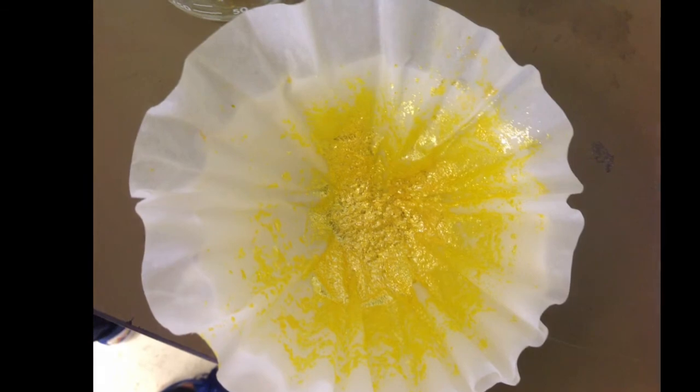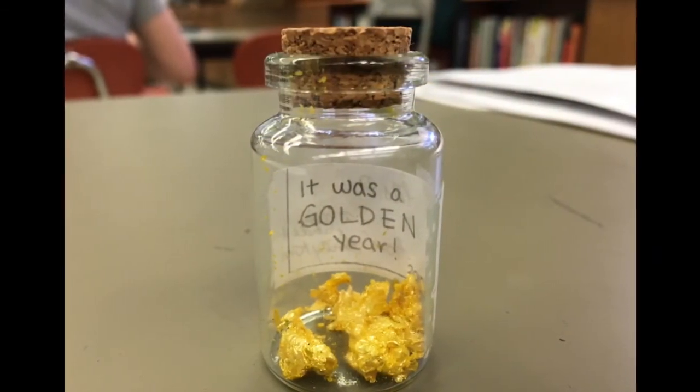The lead-2 iodide precipitate could then be carefully filtered out of the end solution, collected, and carefully stored.